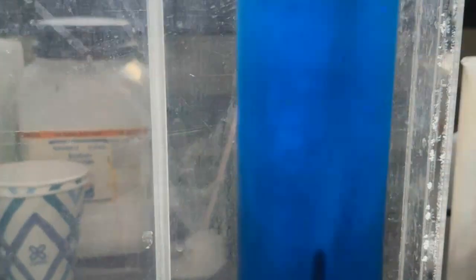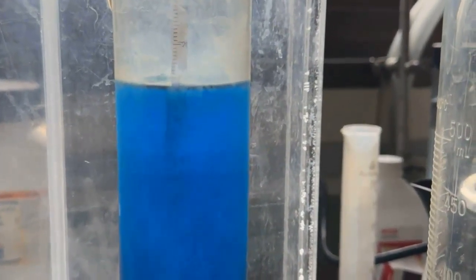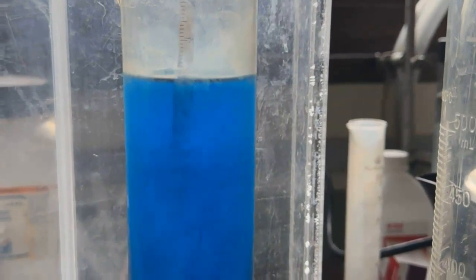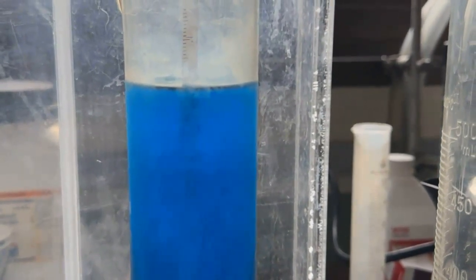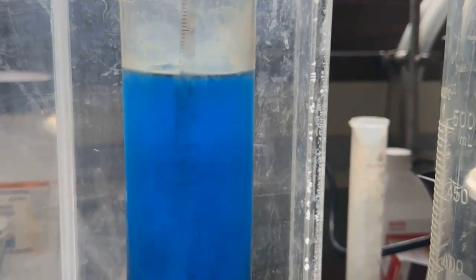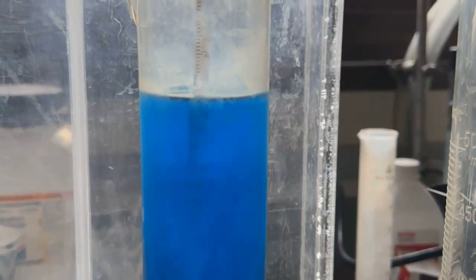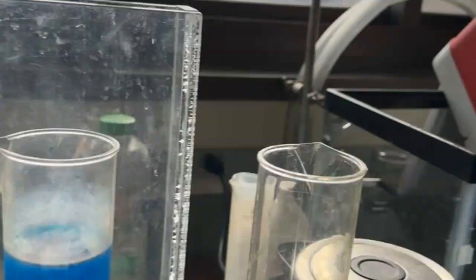And then the blue, the cold water sample, is much, much cooler at roughly, see, it keeps going down, it's a nice and cool sample here. It's at about 11 degrees Celsius. So the cool water sample is 11, the lukewarm is at about 22, and the warm is at about 29 or 30.